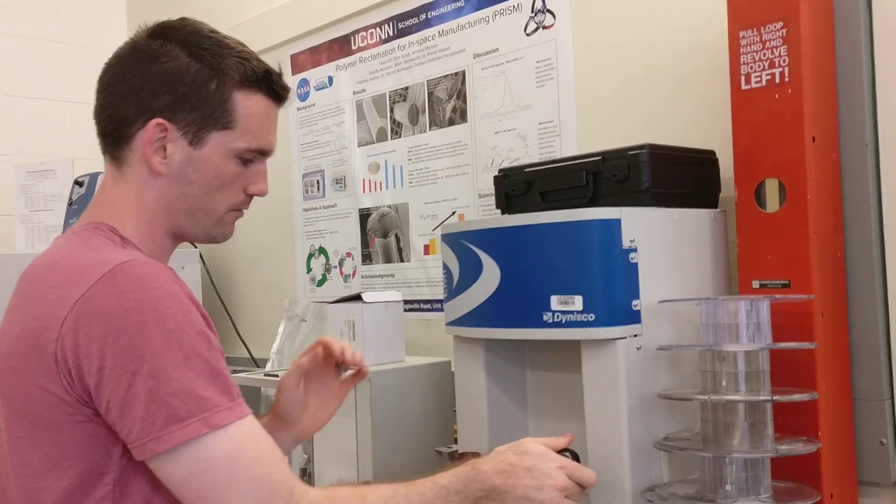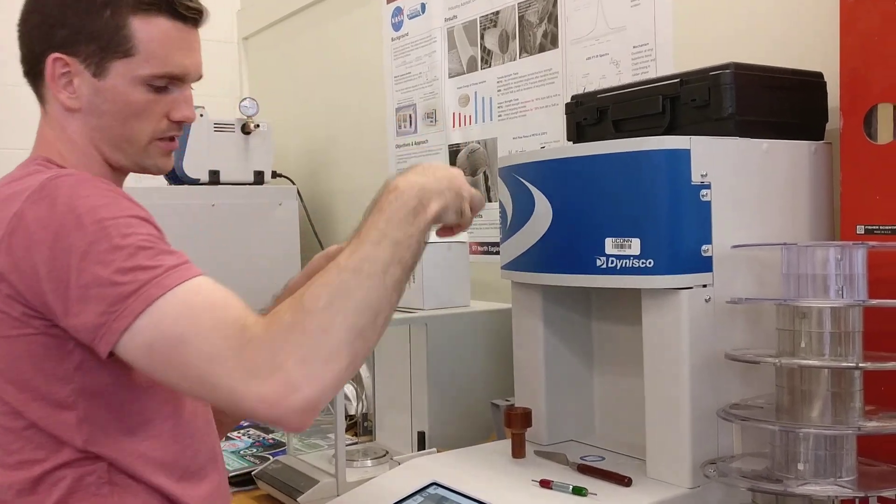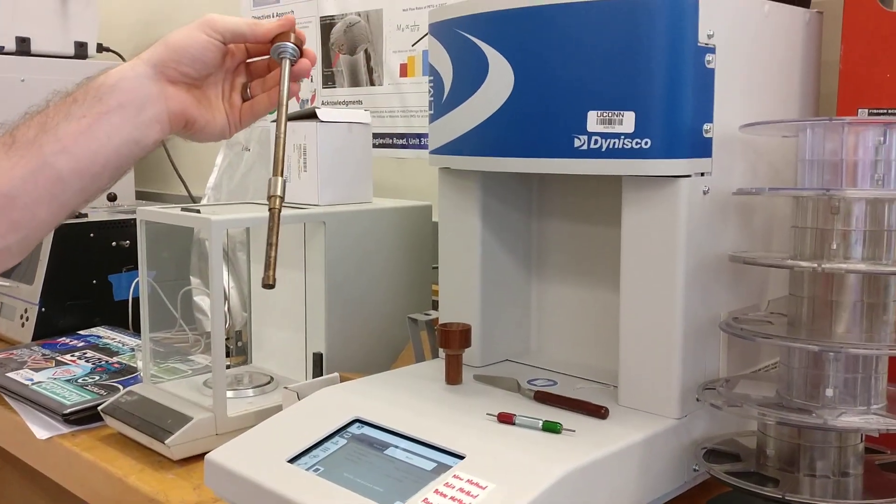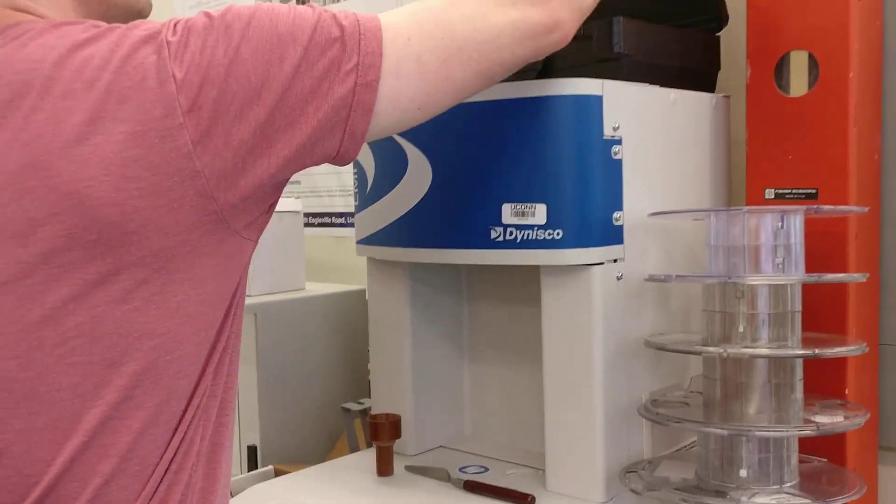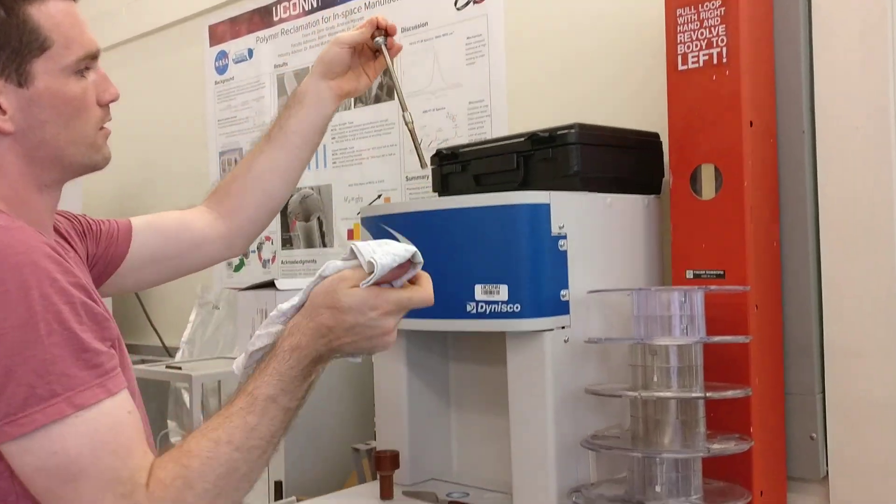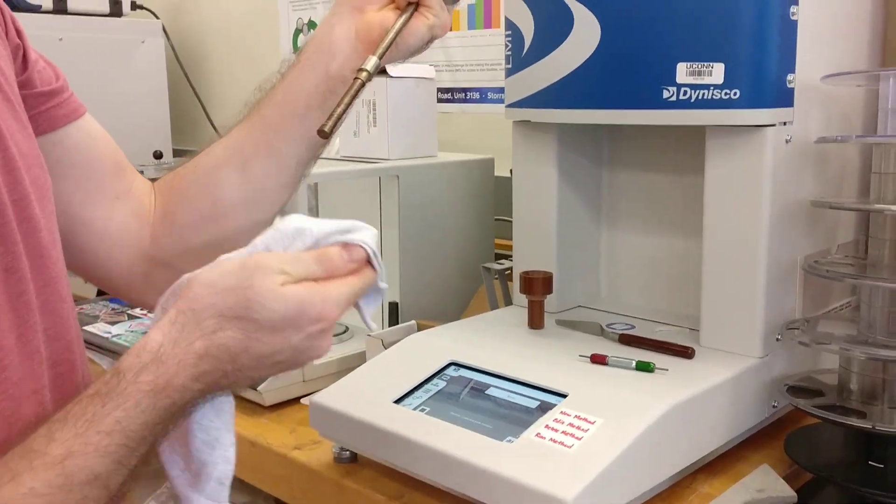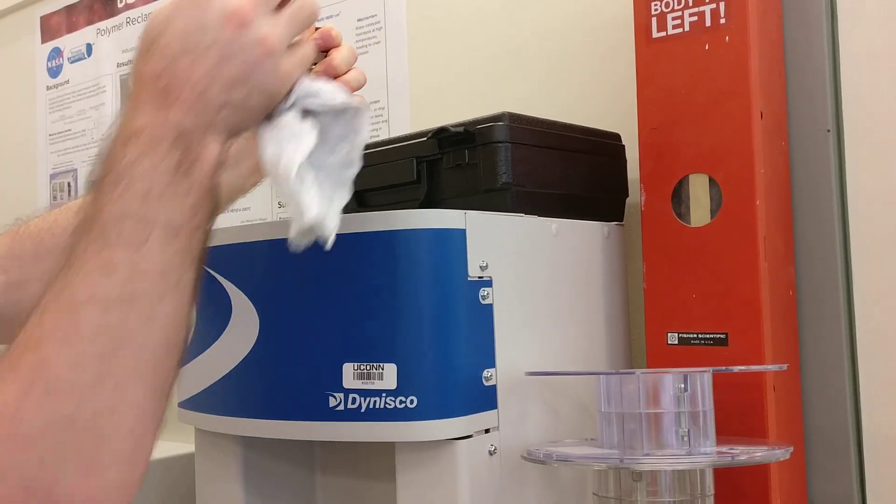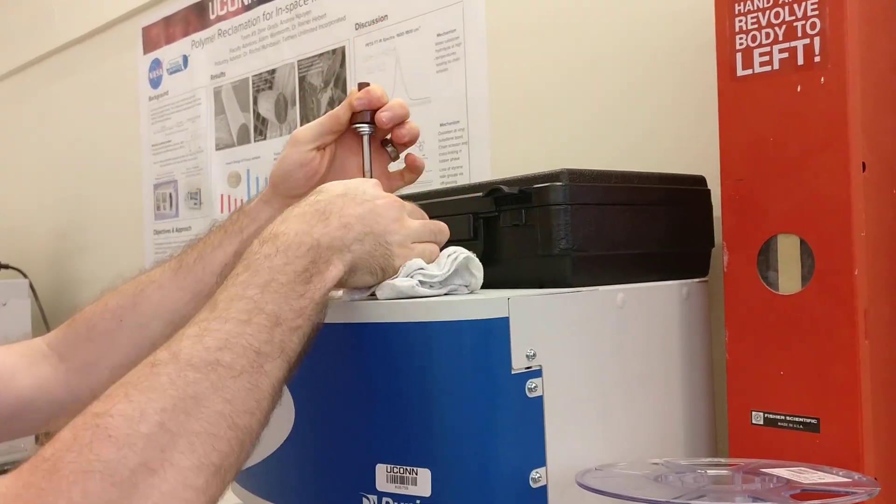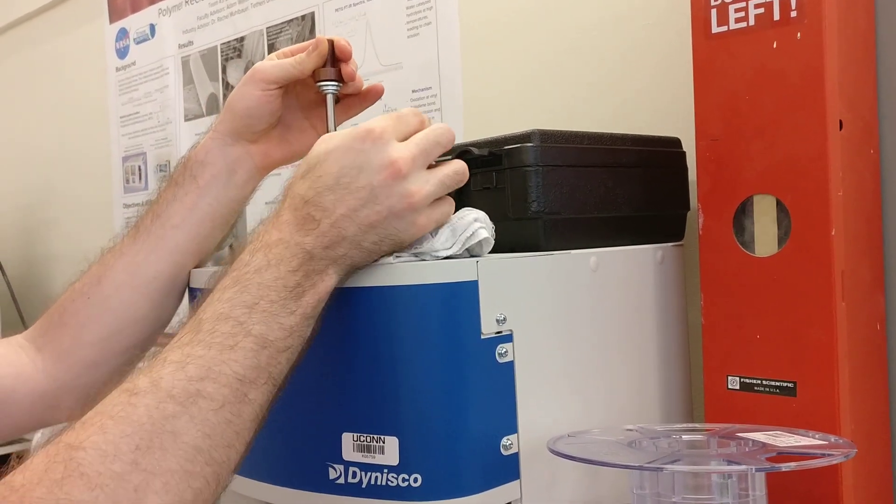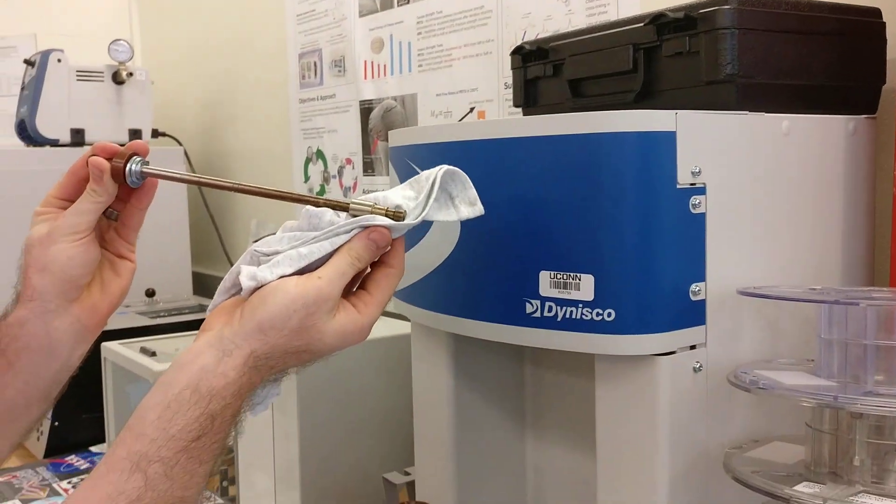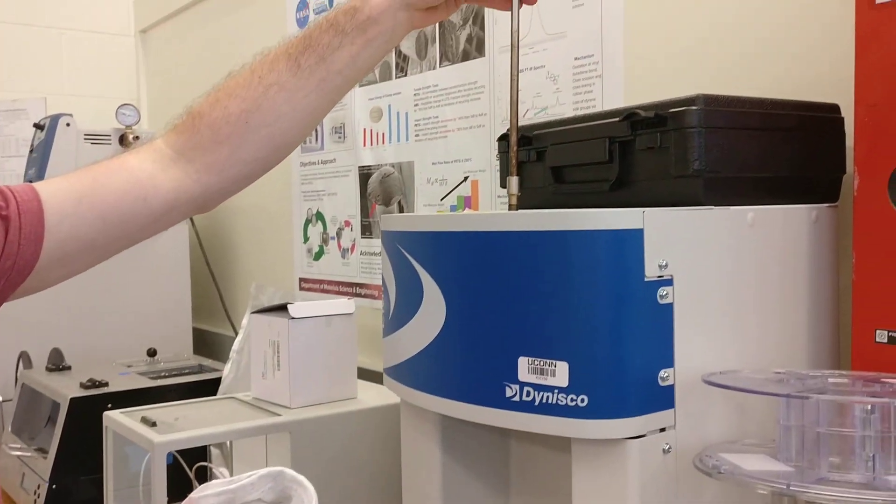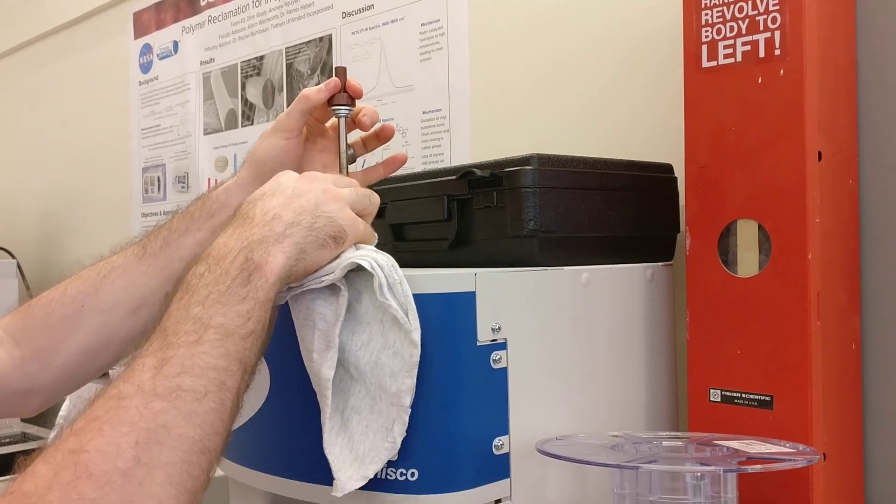Pull the packer out and grab the piston. The piston looks like this piece. It should probably be cleaned with some cloth. There are some cotton rags in here. While it's hot, you should wipe this off so that this piece flows smoothly, so that when you put it up here, this piston is able to travel smoothly through that ring.